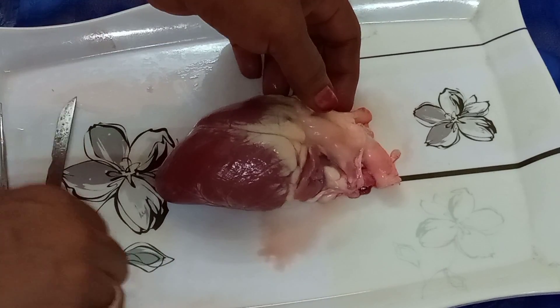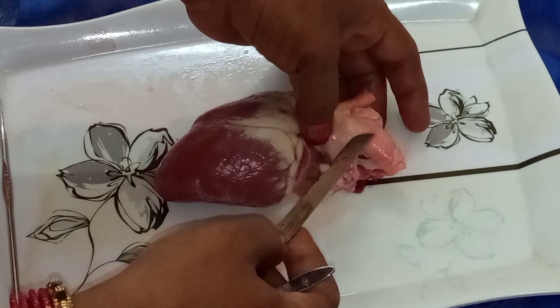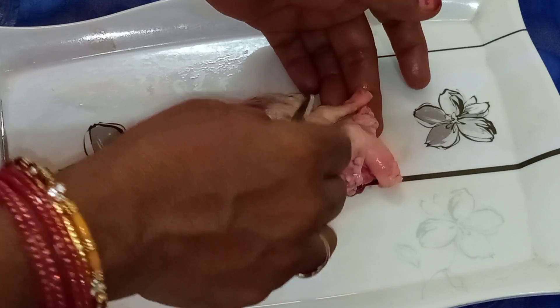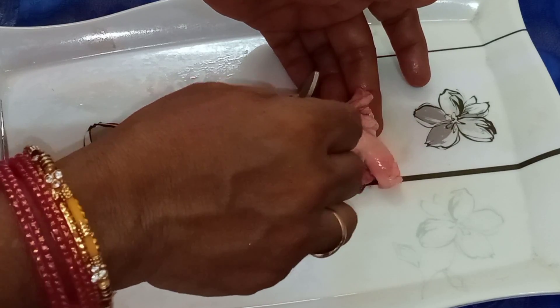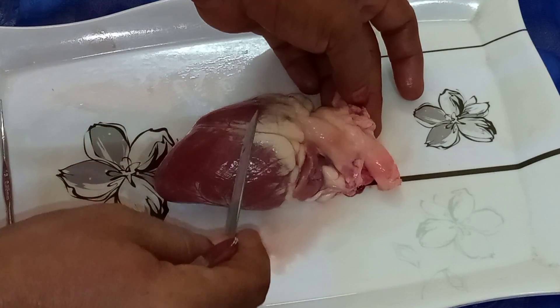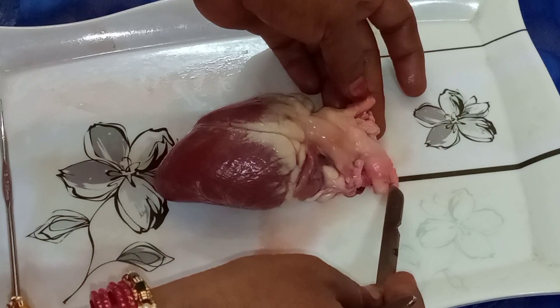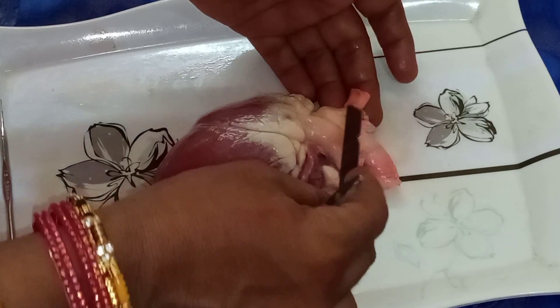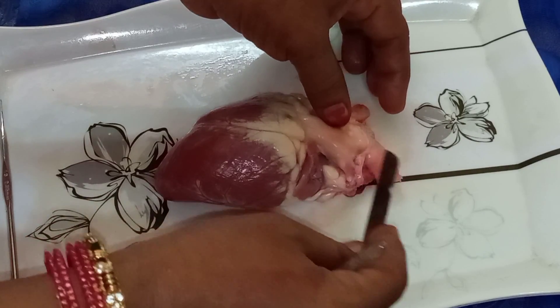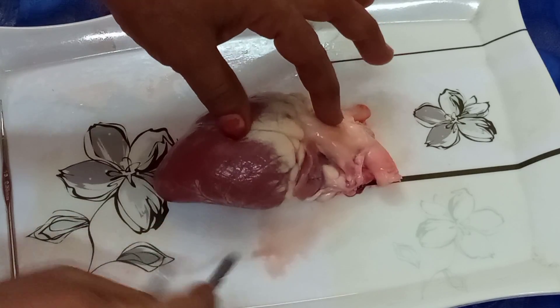This is the biggest artery — this is the aorta, the biggest artery. And these are the pulmonary arteries. The aorta supplies oxygenated blood from the heart to the body parts.